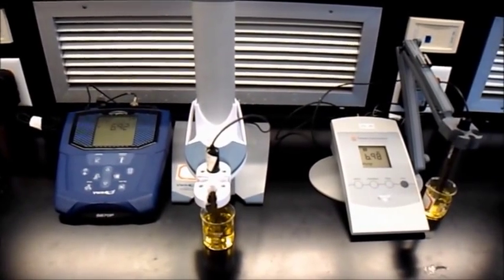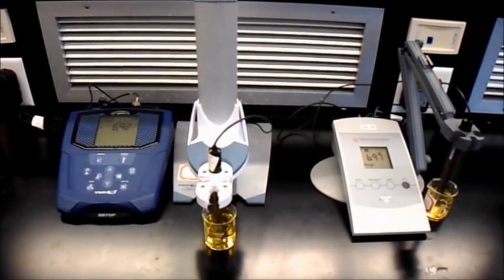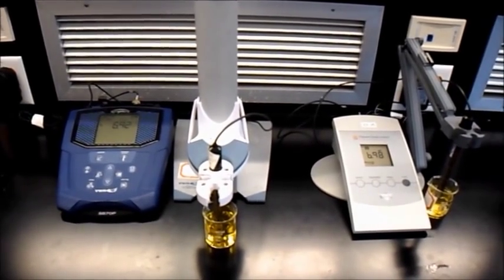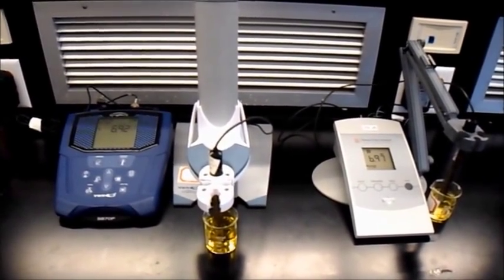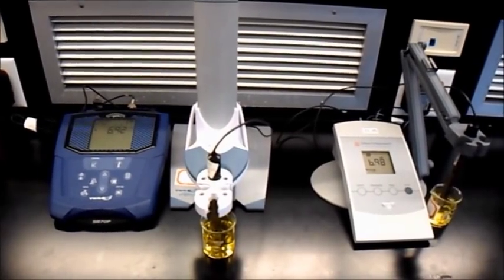You will be working with one of the two types of pH meter shown in this video. Regardless of which meter you get, the care instructions are the same. Treat the probe very delicately and keep it submerged at all times.